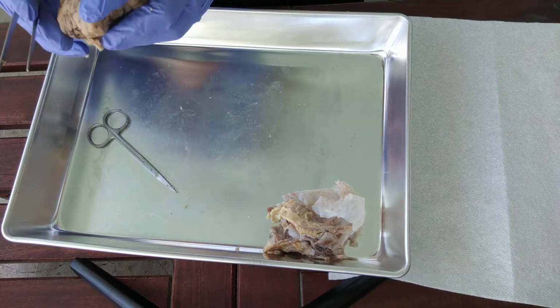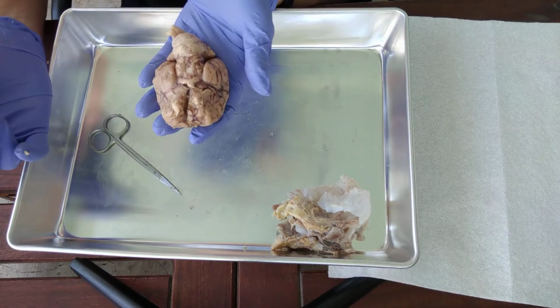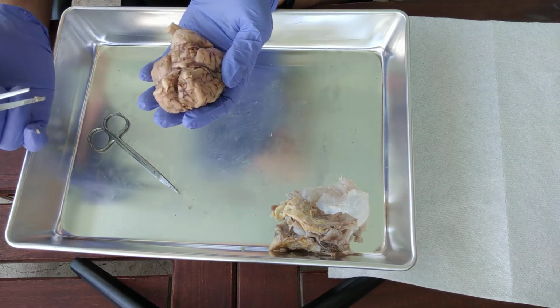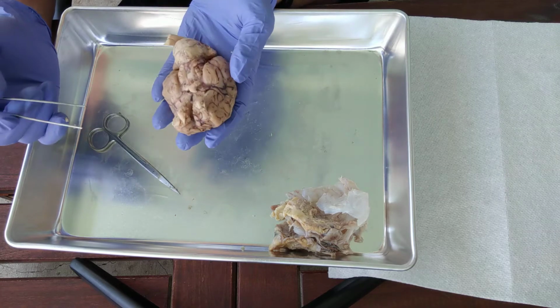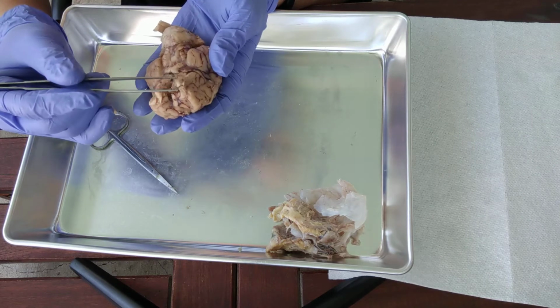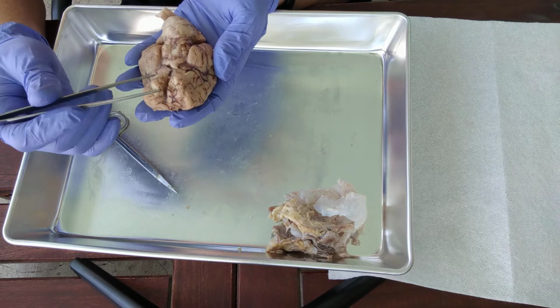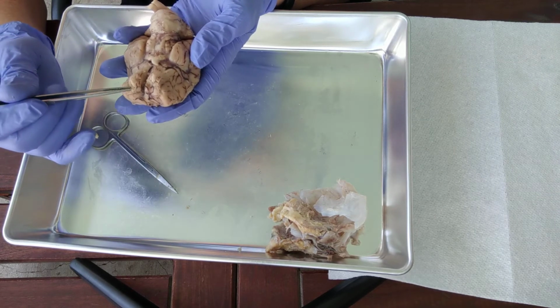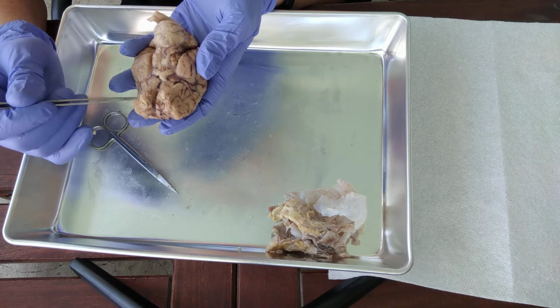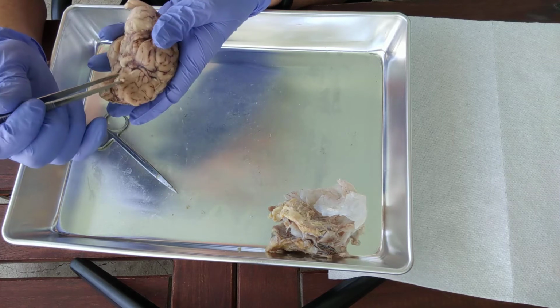Okay, let's see. I think we're done with this side here. Let's flip it over. Now, I feel really unfortunate because my particular specimen was quite beat up in the process, and so I'm missing some of the really important structures, like this right here. This would be the olfactory tract. Now you can see just a tiny little bit of my olfactory bulb. So see this enlarged part at the end of the olfactory tract. So here's the olfactory tract. There's a little piece of it there.